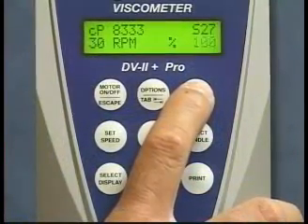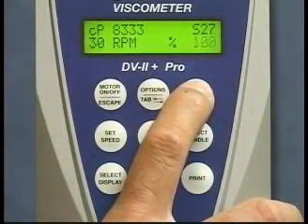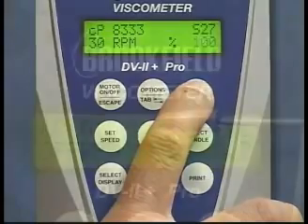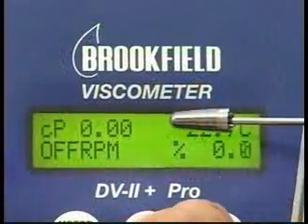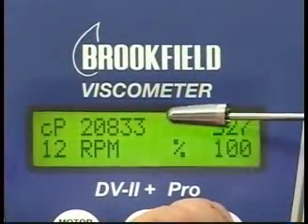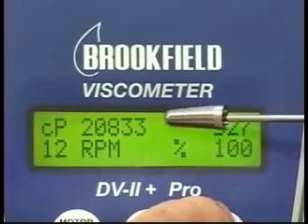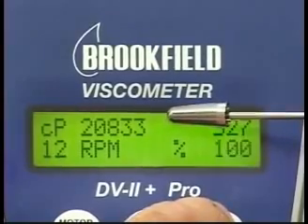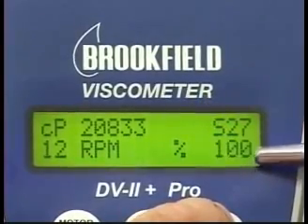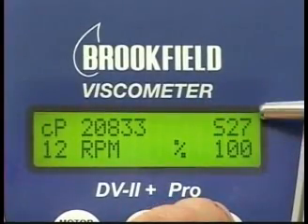The speed in RPM will be displayed by default as the motor is running. With the motor off, select auto range. Displayed will be the full scale range, the speed and RPM that has been entered, 100% torque, and the selected spindle.